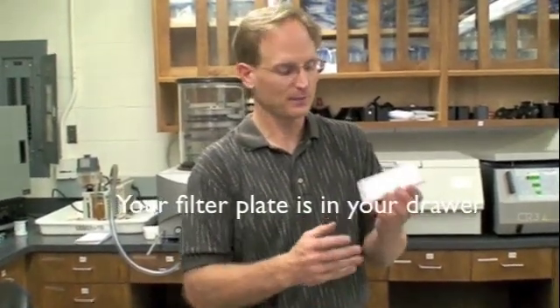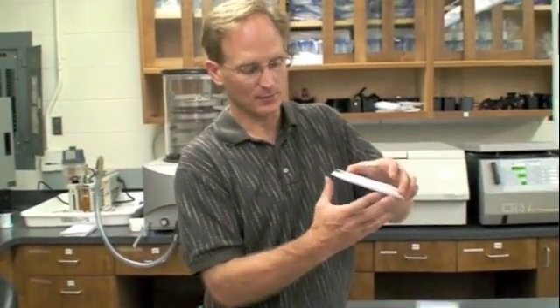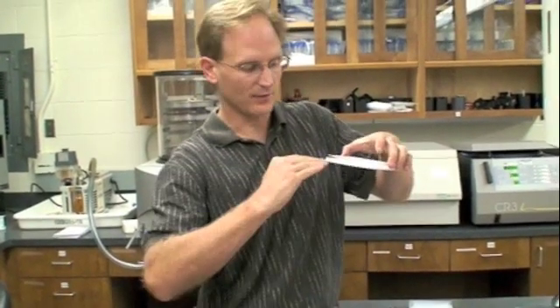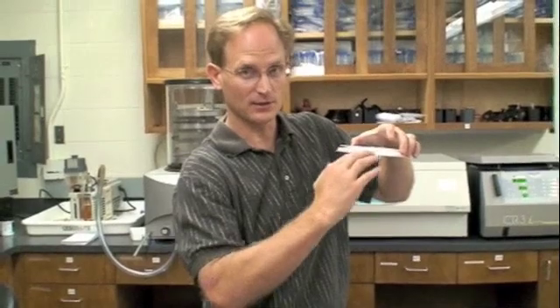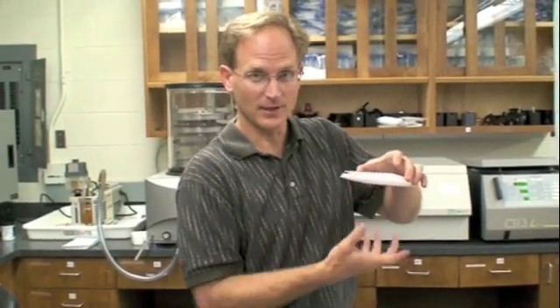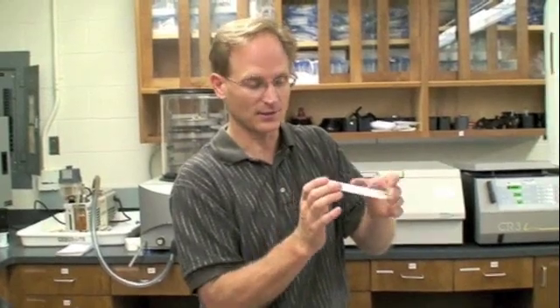What we need to do is use this filter plate. It's called a filter plate because of this hard clear plastic on top and a soft plastic on the bottom. This softer plastic is actually holding together a filter paper that's sandwiched between these two types of plastic. Don't take this off. This is not meant to be removed. It always stays like this.